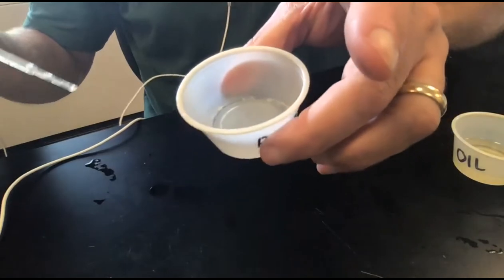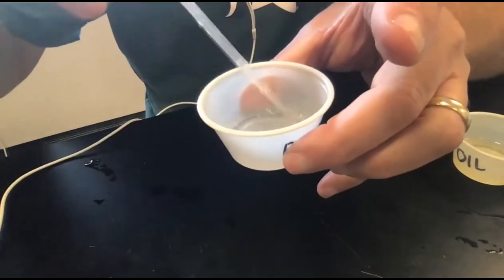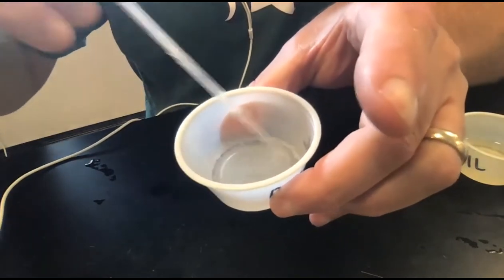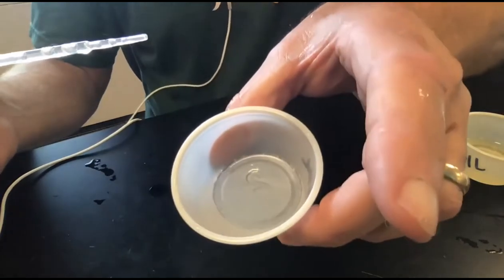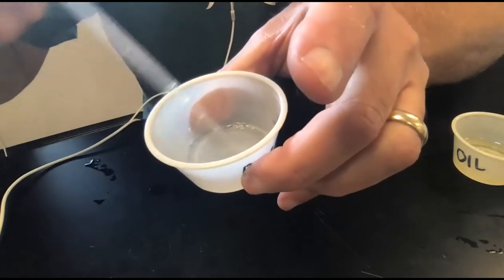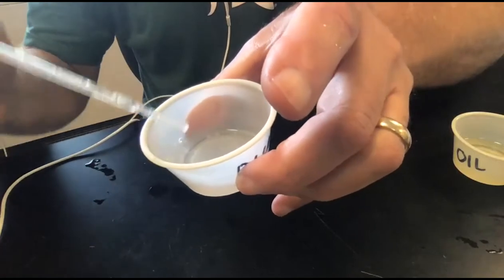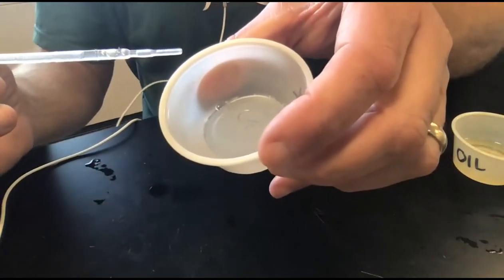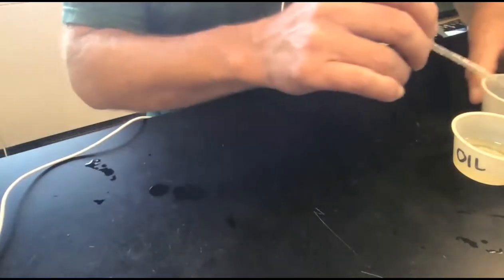I don't know if you can see those 3 little drops, and I start moving it around, I can see that it breaks up into smaller chunks of liquid, smaller chunks of lipids, I'm sorry. So the alcohol is able to get in between the lipids and break it into smaller particles of lipids. So in a sense, the lipids are dissolving in the alcohol, whereas in my water example, the oil doesn't separate.